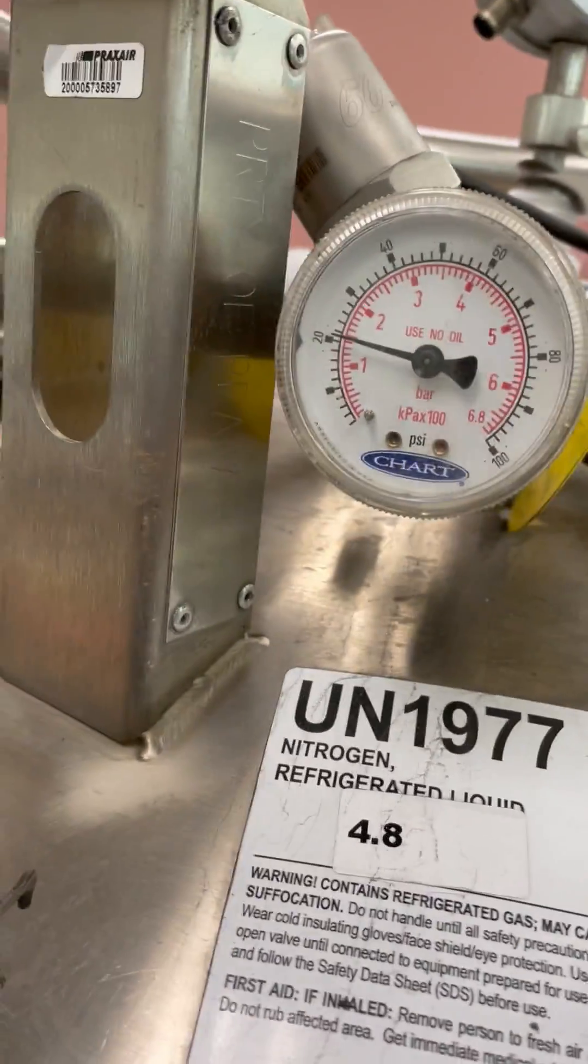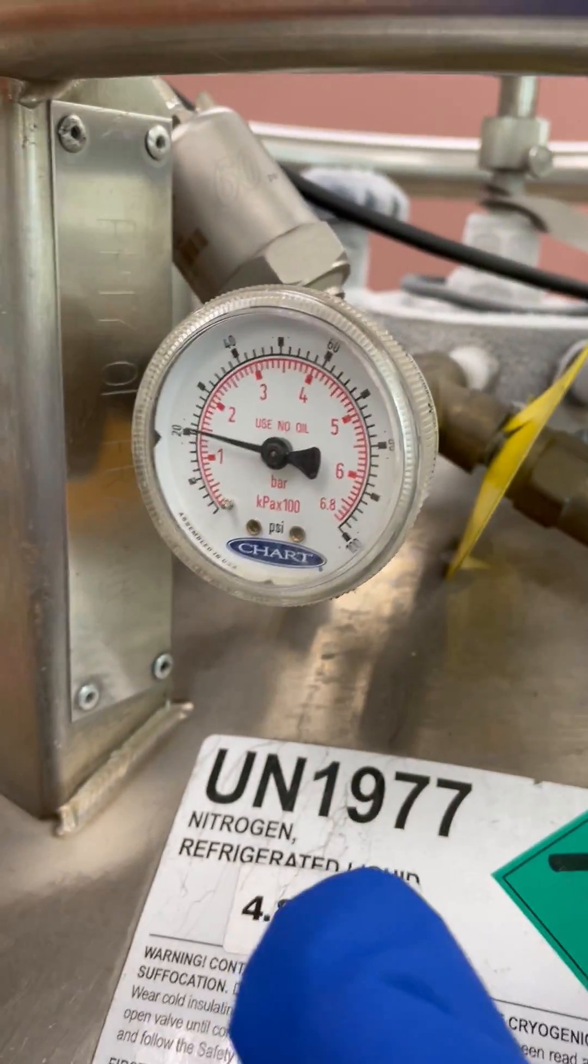Now, and also, for the gas pressure, it should be about 20 psi, like what you are seeing here.